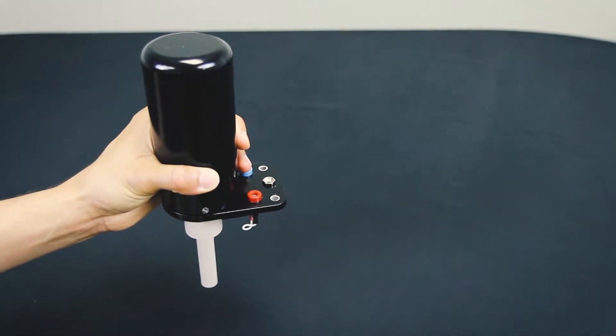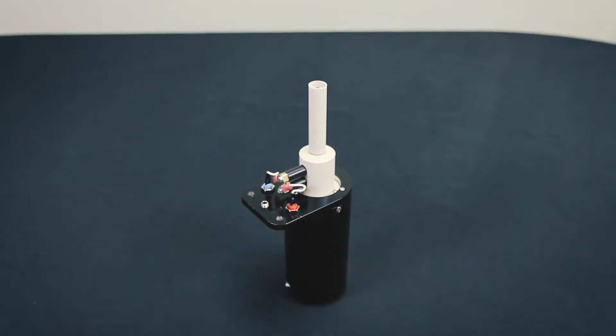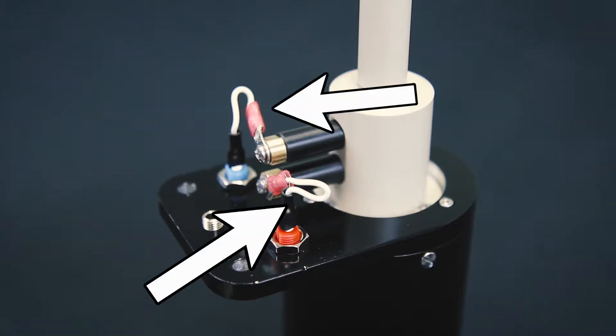Turn the motor unit upside down where it can sit on a flat surface. Next, remove the screws that connect the wires to the ring and disc brushes. Before removing them, take note of the crimp orientation. Both crimps should be in the same orientation when reassembling the wave vortex.